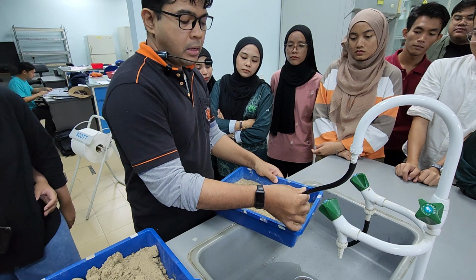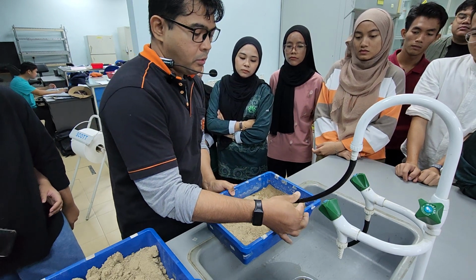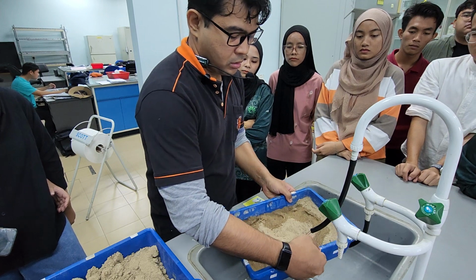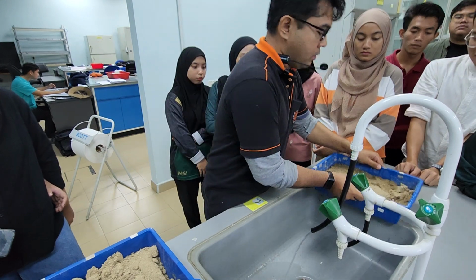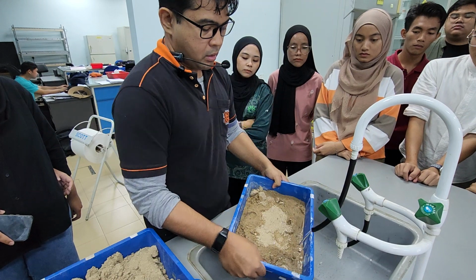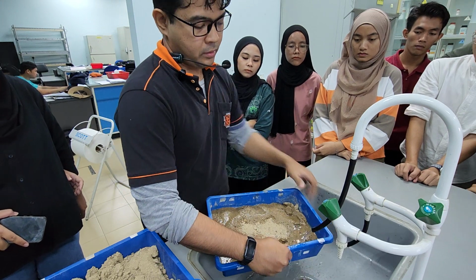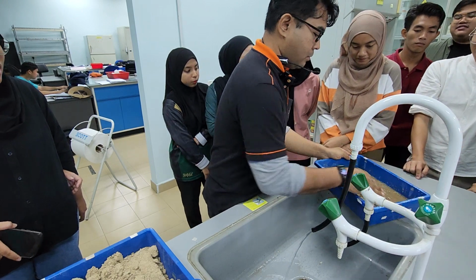So maybe you can ask your friend to help. Turn this box while you have this water running. And then give it a good bang. Do it again. Usually if you do it 2 rounds, the moisture should be enough. Why? Why do it this way? Oops, sorry. Evenly spread.